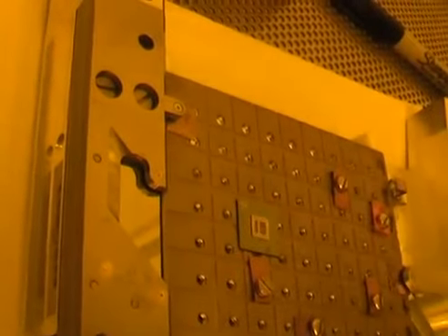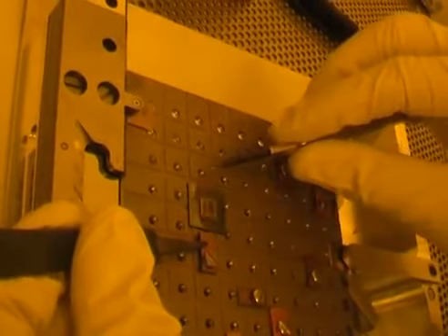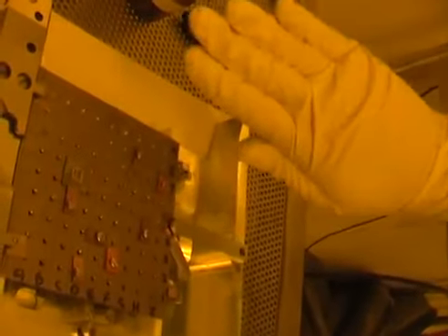Users often ask for the minimum amount of clamping on their samples. What you have to be aware of is if you don't put enough of the sample under the clamp, the sample won't sit flat. So there I've got about 1 millimetre of the sample under the clamp. And if I tighten that, the sample, instead of sitting flat, will actually tilt up like that. And that's no good. I need to put a little bit more under the clamp to make sure it's going to sit flat.